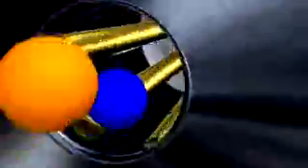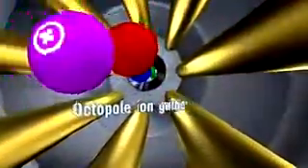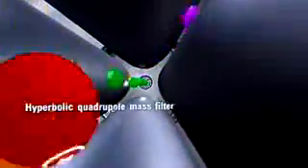An on-axis octopole ion guide provides nearly 100% ion transmission over a wider mass range. Patented lenses enhance high mass ion transmission and increase sensitivity over a wider mass range. The quadrupole mass filter allows only ions of the target mass to pass through, and the hyperbolic shape of the rods enhances ion transmission and spectral resolution.